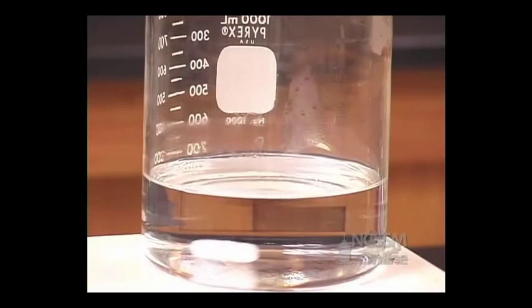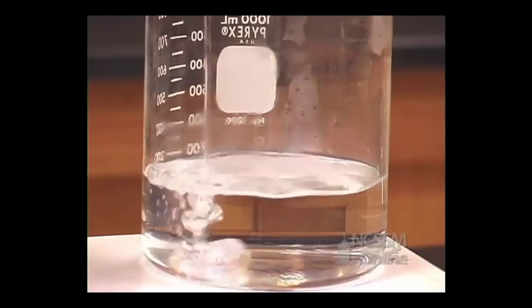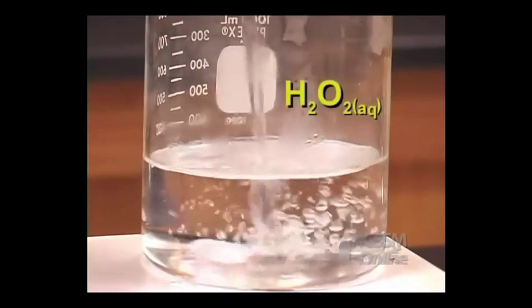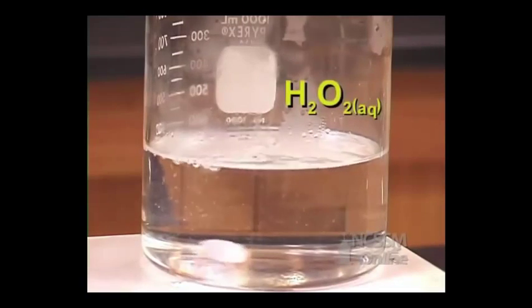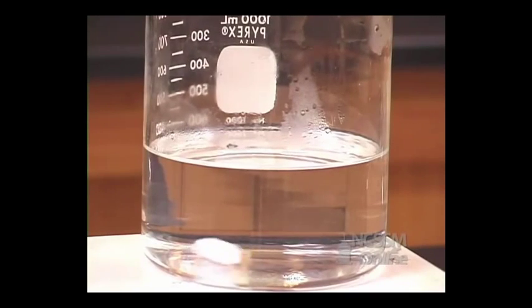In a demonstration to show a solution catalyst, we will heat a solution of sodium-potassium tartrate. We will add a solution of hydrogen peroxide. The reaction is very slow initially, even at 60 degrees Celsius. We will then add some cobalt plus 2 ion.